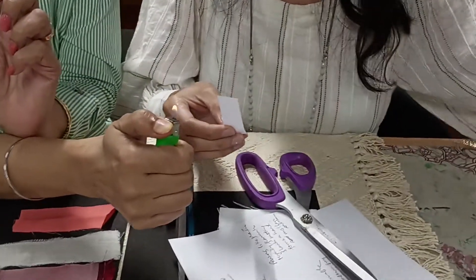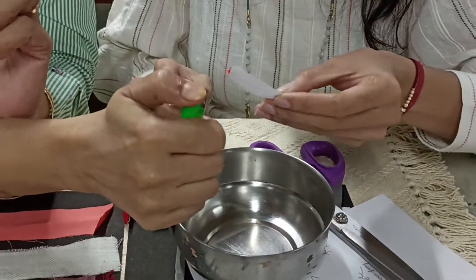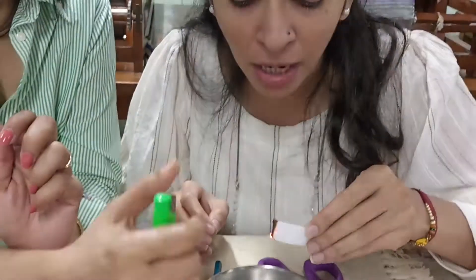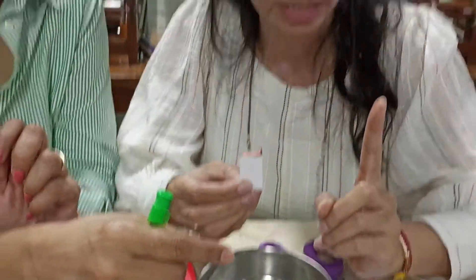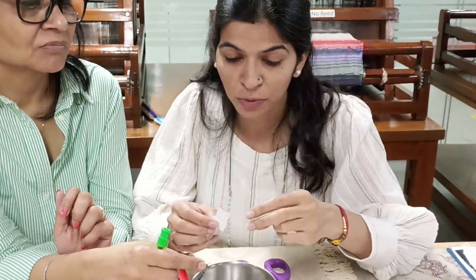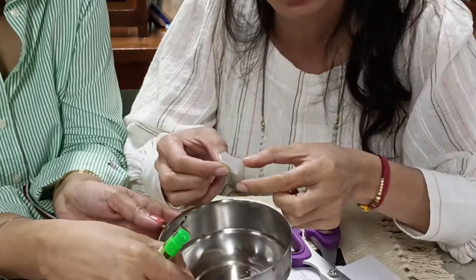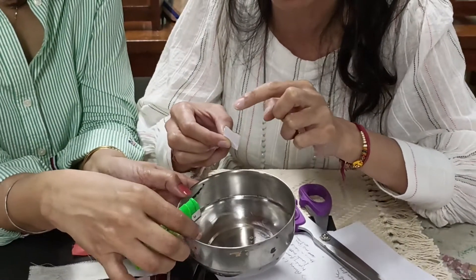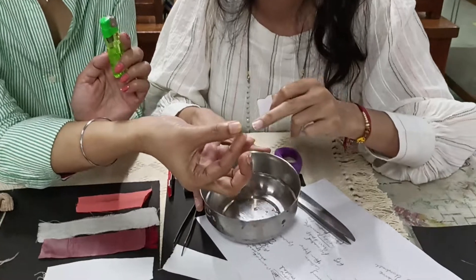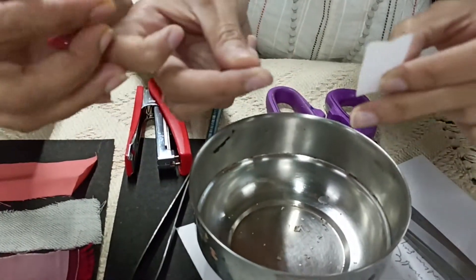Be very careful while doing the burning test, because residues in some fibres drip down. In case of cellulosic fibres, it's a paper — all of you must have seen how a paper burns. It catches fire quickly, it is highly flammable, and it is not self-extinguishing. You have to blow off the flame. You can see the residue dropping down — it's very light and feathery in nature. There was an orange afterglow, which is the remaining flame on the edges of the paper. The residue is soft, easily crushable, and very light — a somewhat grey coloured ash.